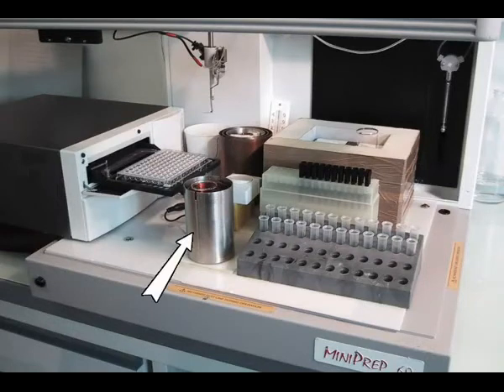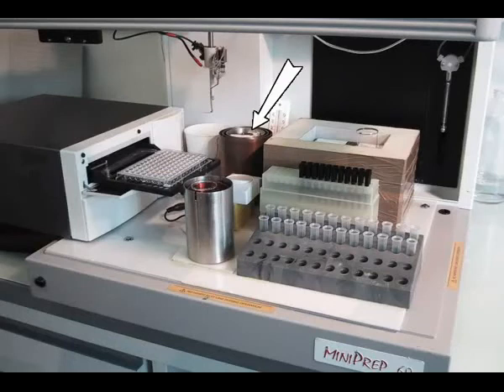On the left, the small cylinder contains water added with calcium chloride at a concentration adjusted to start the coagulation of plasma after around 15 minutes. And the copper cylinder on the back contains the coil that will deliver the signal to the water.